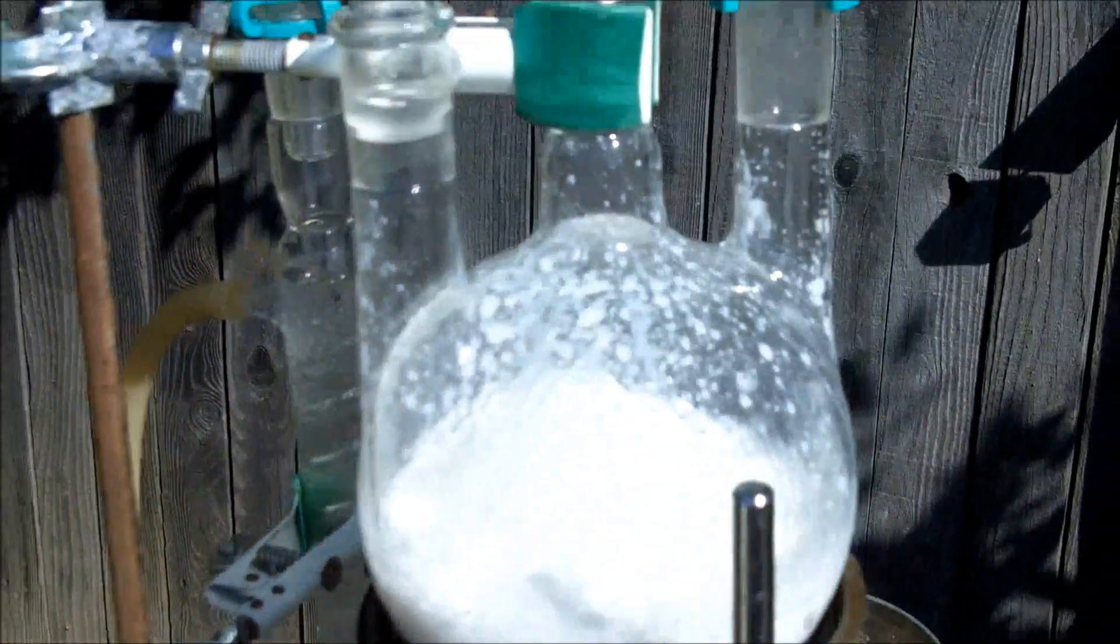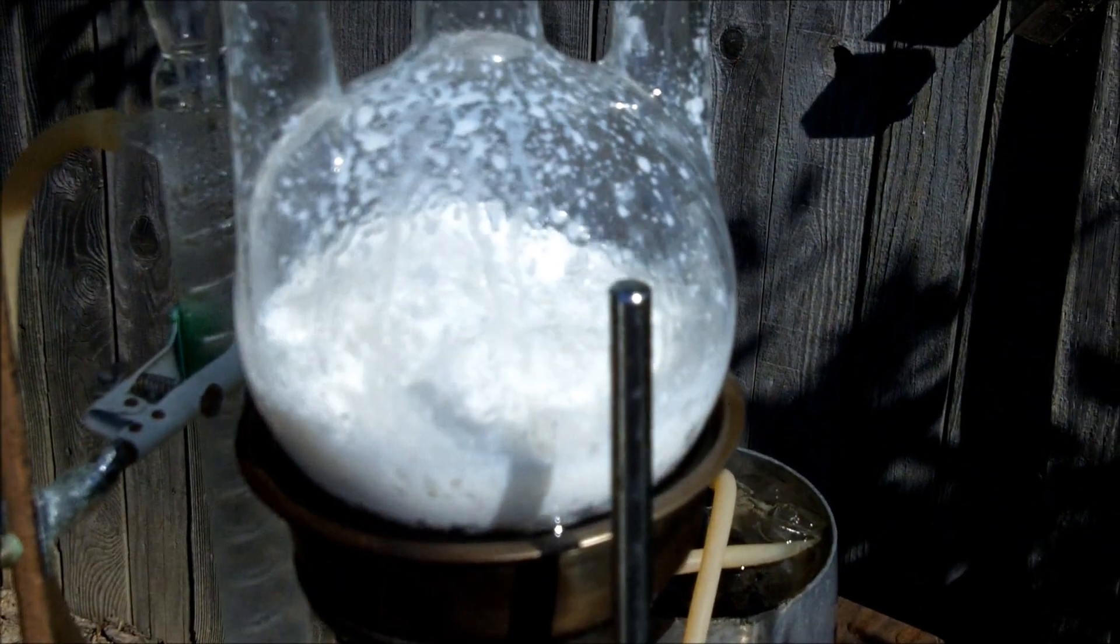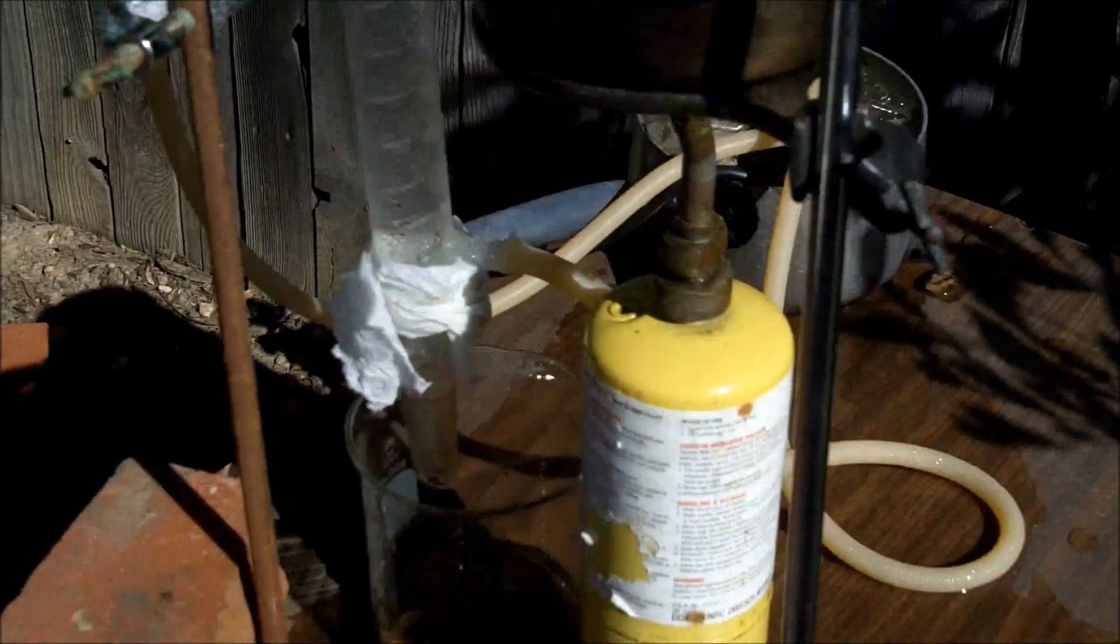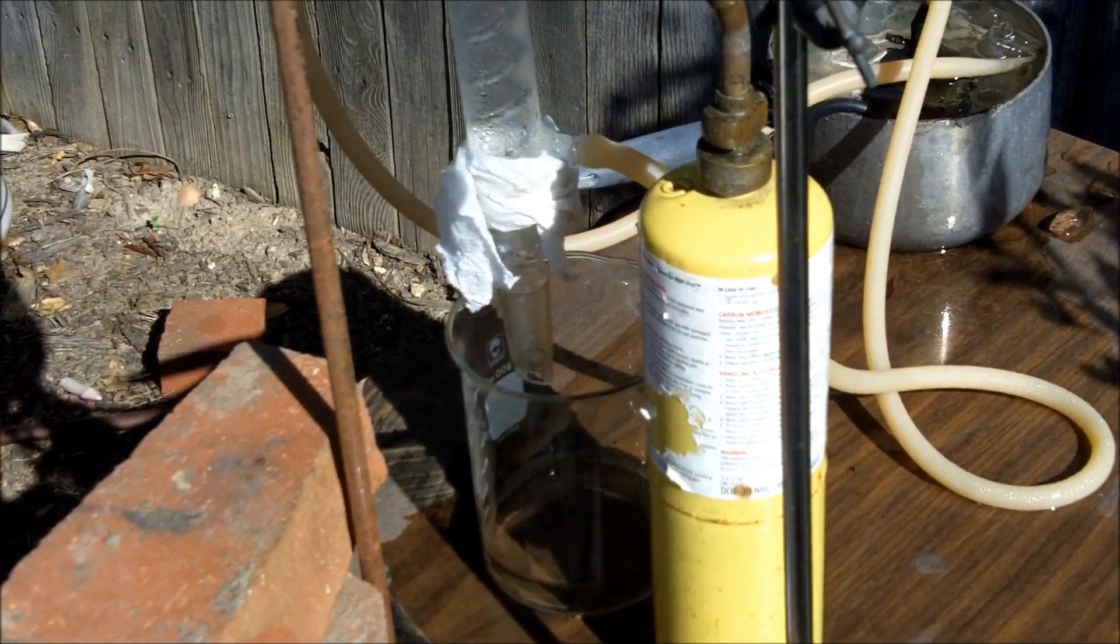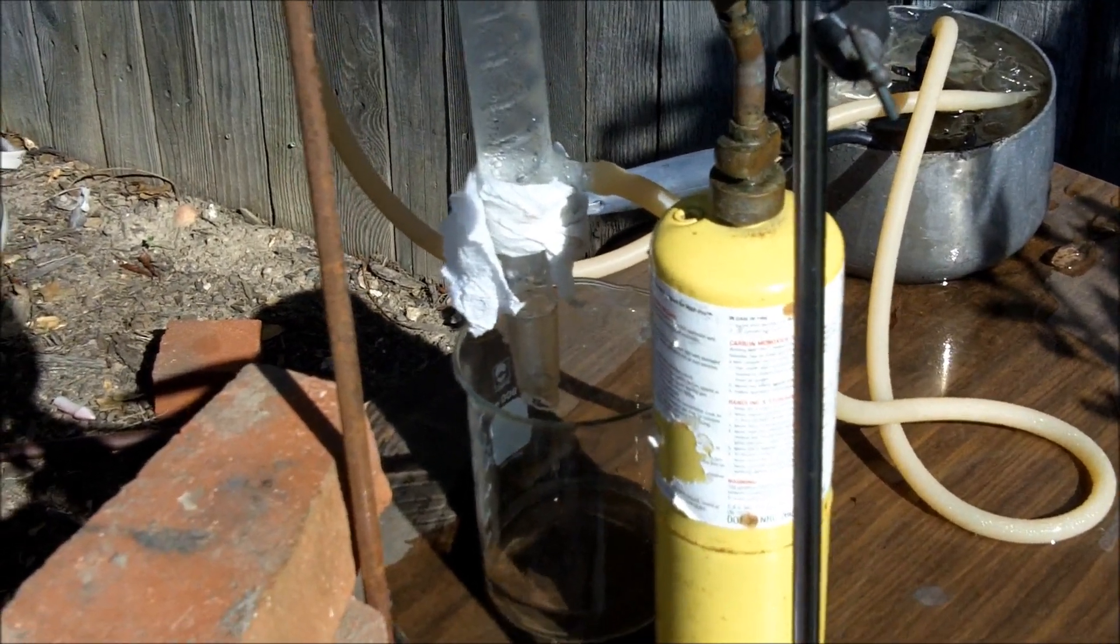If not okay with you, then just distill over everything and separate out the bottom layer. Then dry that bottom layer with a saturated salt water solution, and yeah, there's your product.